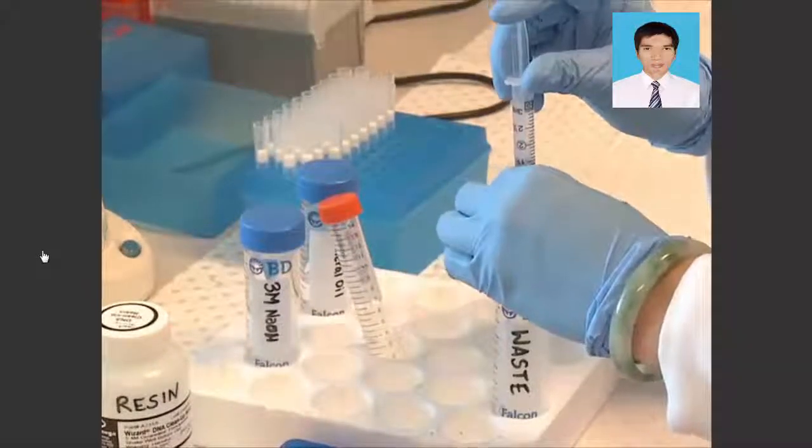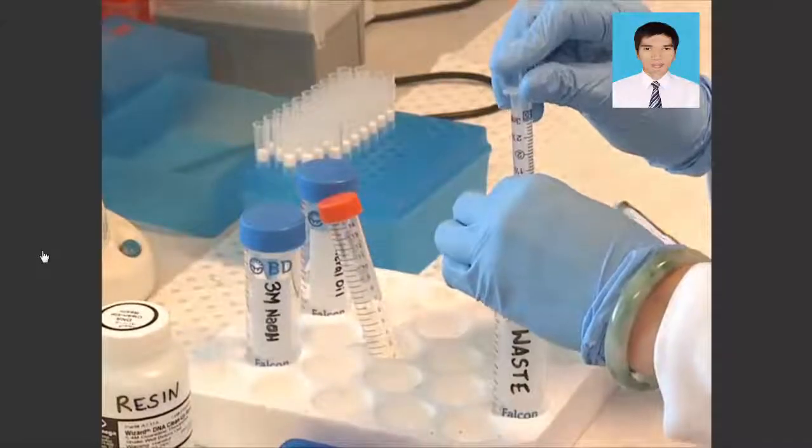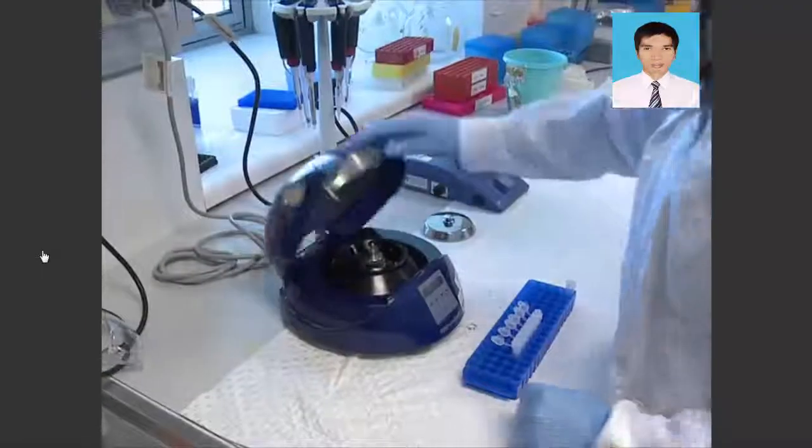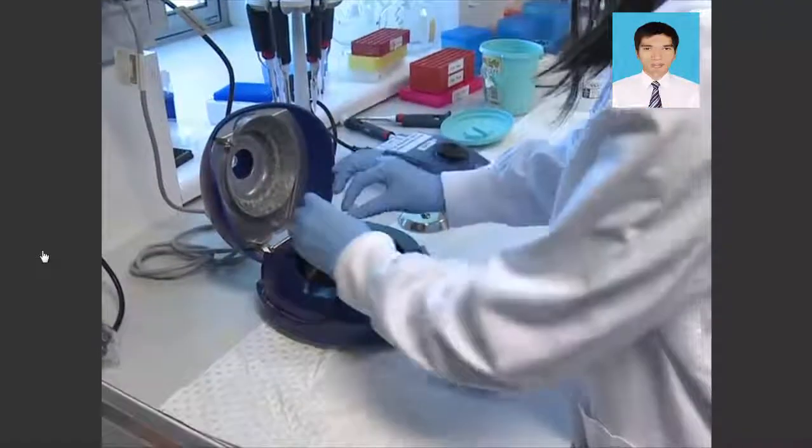Finally, to remove any free bisulfite ions, pass the bisulfite-treated DNA through the desalting column and elute in 50 microliters of MilliQ water.